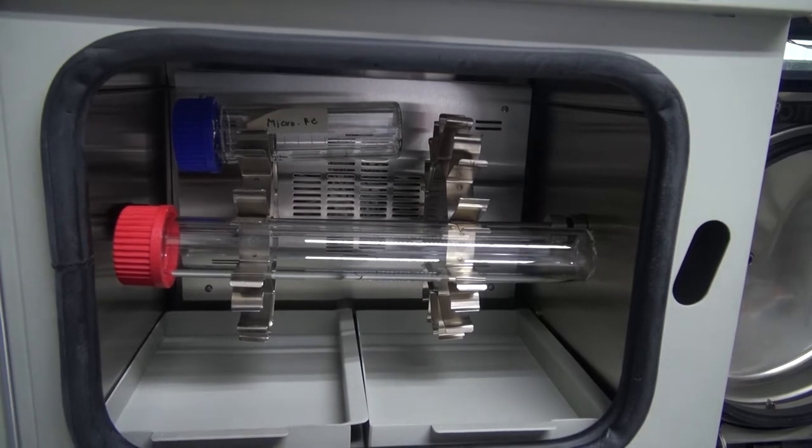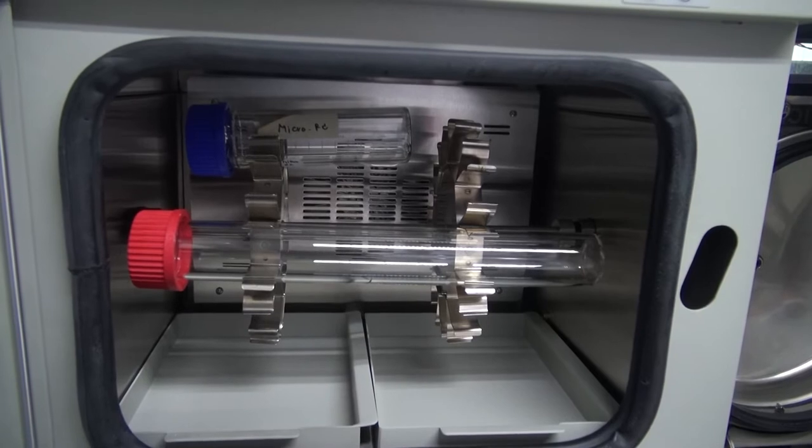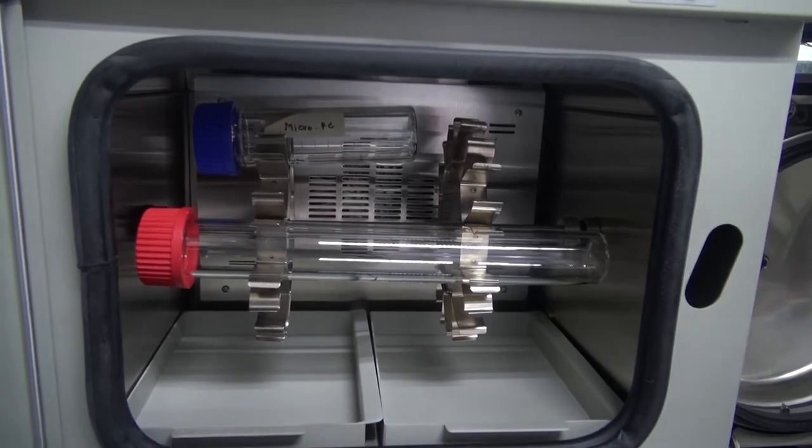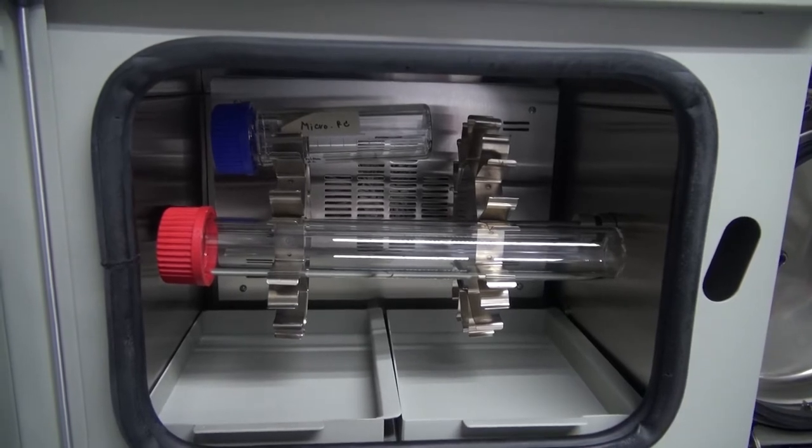Always use an even number of bottles and load bottles opposite each other to balance the bottle holder. This prevents the excessive wear of bearings and the drive motor.